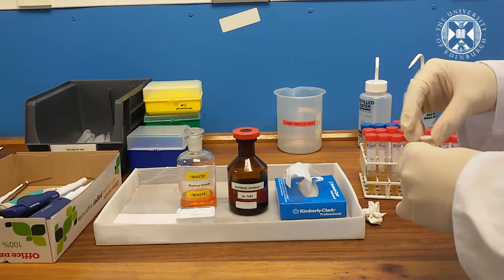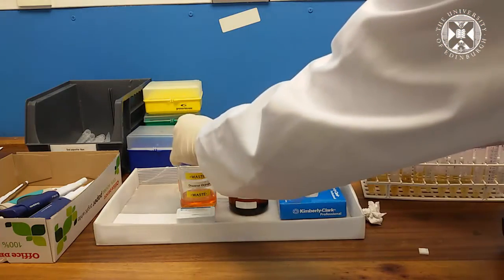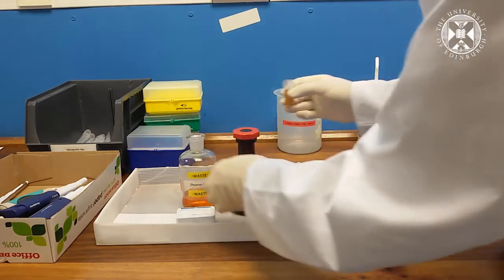After this experiment is done, remove your sample and pour the waste solvent into the labeled waste bottle.